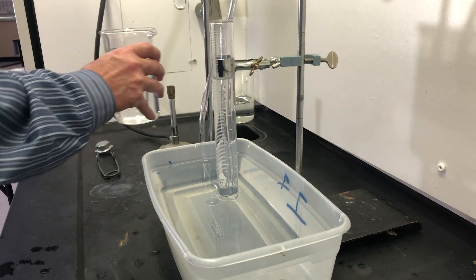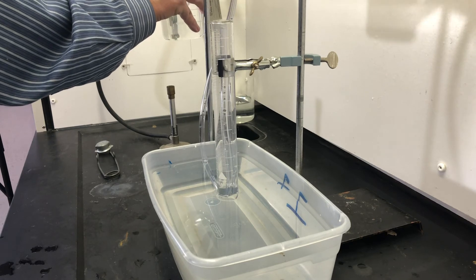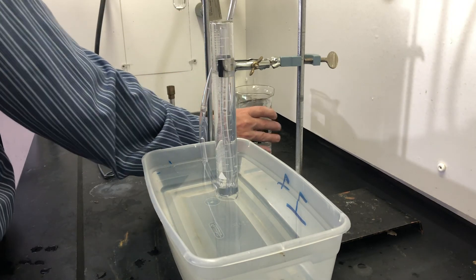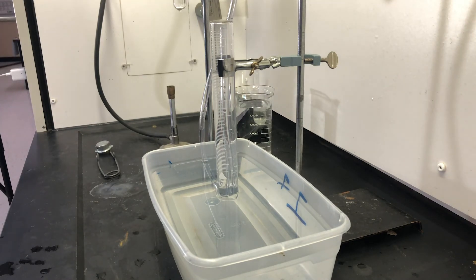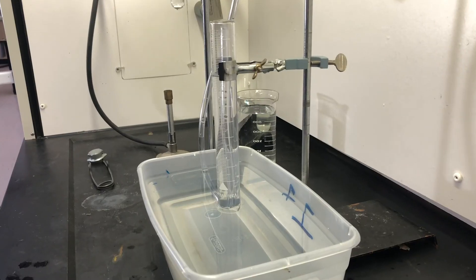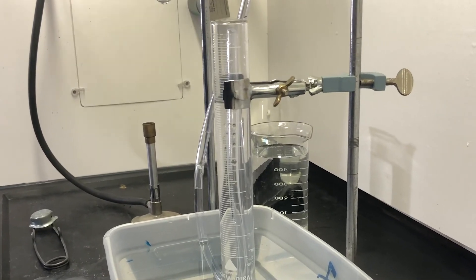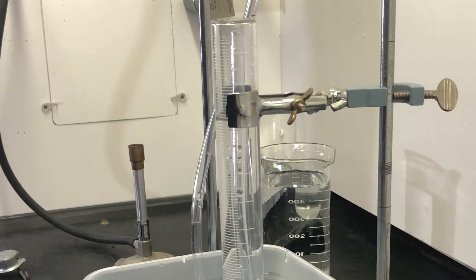So after some time, it has cooled down. You've looked your numbers up, you've gone to your weather app and found the barometric pressure. Now I have this container of room temperature water. I'm going to immerse the test tube in there and finish cooling it off to room temperature. By doing that, we're going to bring this process to an end. I'm subtracting off my original volume of gas, and that's going to give me a volume of gas collected. Convert that to liters, and then run that through the PV equals NRT equation to determine the number of moles collected.